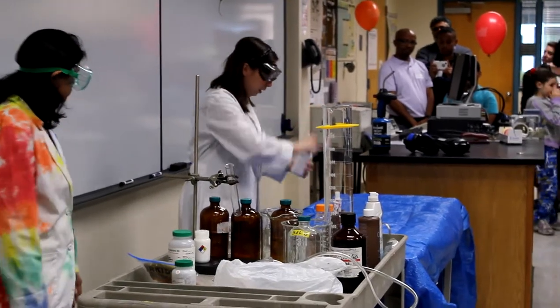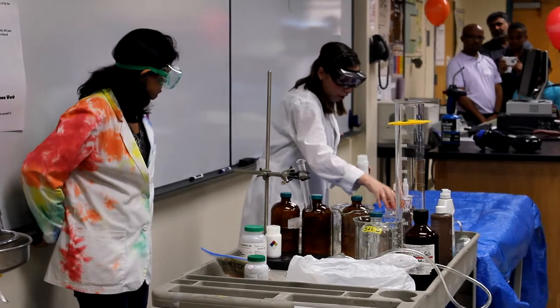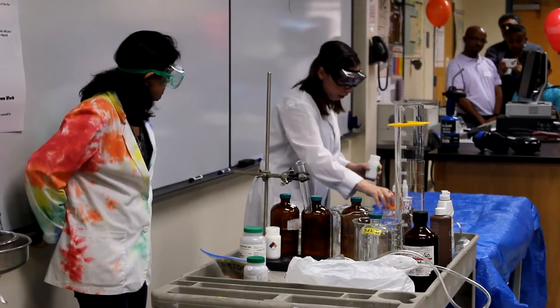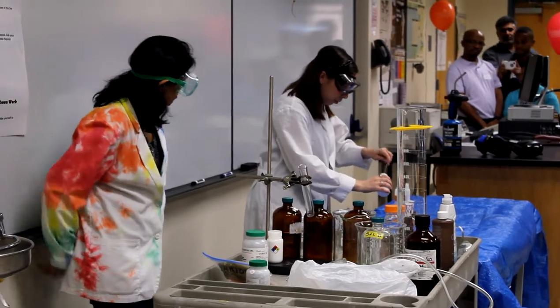So what I have here is potassium permanganate, and we're going to mix it with glycerol for our delayed fire. The reaction is a little bit slow but it'll go.